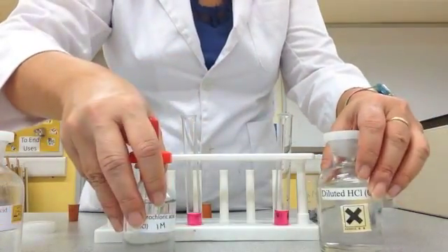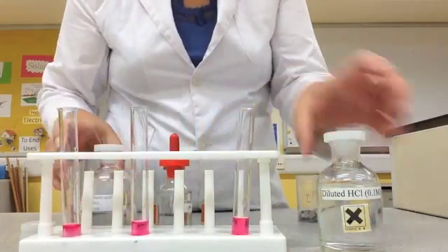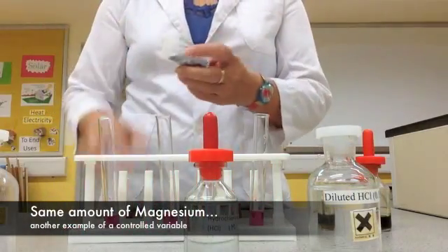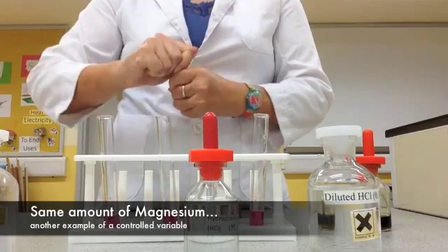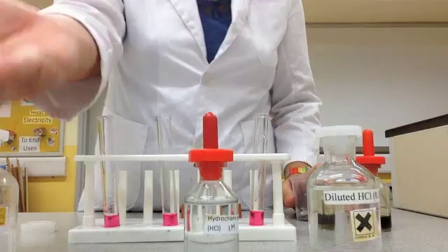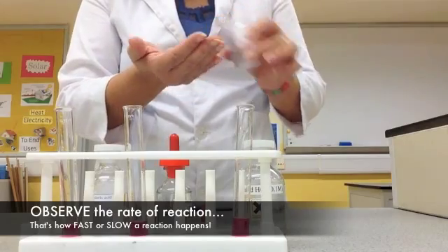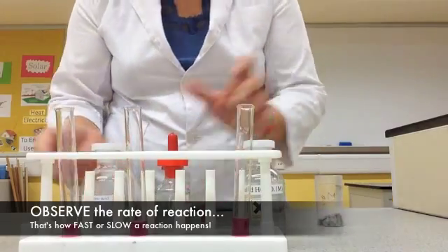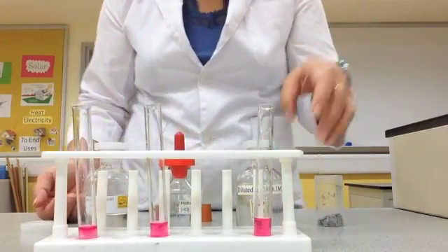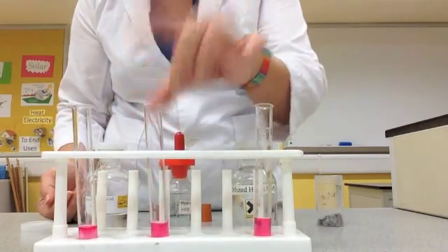This is 0.1, this is 1 mole, and this is 2 mole. I'm going to add magnesium strips — the same amount of magnesium in each. These magnesium strips are cut so I want you to look at how fast or how slow the reaction is. When you get to year 9, you'll know one sign of reaction is fizzing, and another sign of a chemical reaction is when it produces heat.